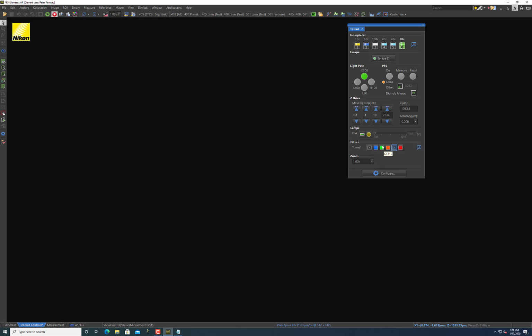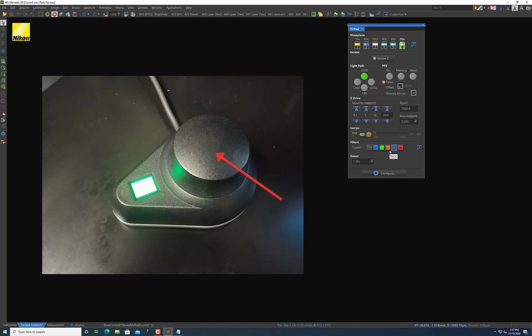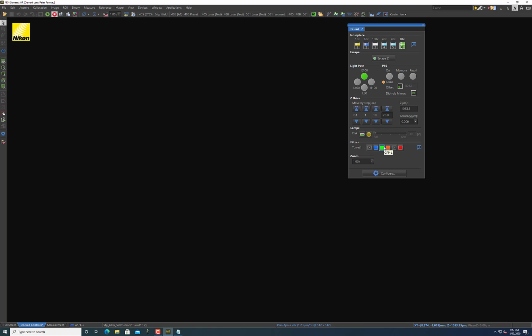So if I want to look at this sample, the fluorescence, I need to, as I said, select a filter cube and then also turn on my LED light source. Now, you'll notice, or maybe you'll notice now, that there isn't actually a button for turning on the LED light source in the software. And that's because in order to turn on the LED light source, you have to actually turn on a physical button, and you'll need to press down on this black circular dial to actually turn on and engage the light source. Basically, I'll need to select the filter cube that I want, and then I'll press down on the black button, and what you'll see is some rays come out from this horizontal line that's on the little LED screen on this LED light source controller. And that will indicate to you that the light source is on.